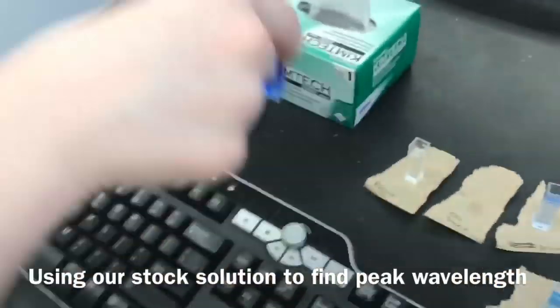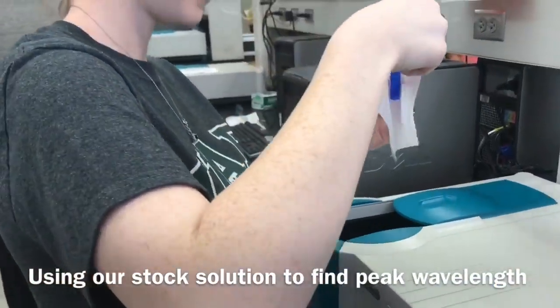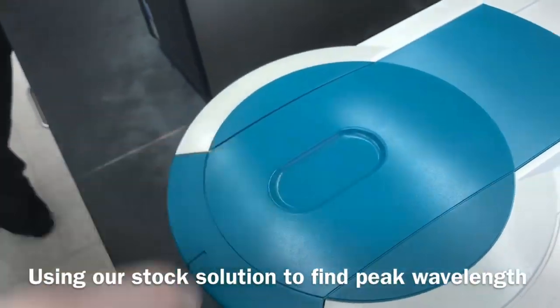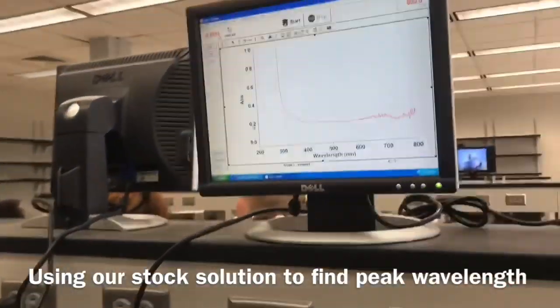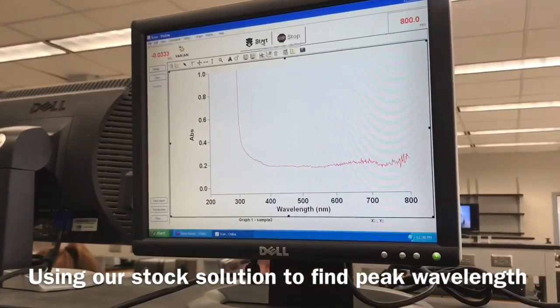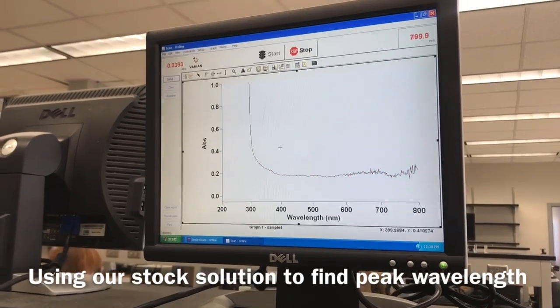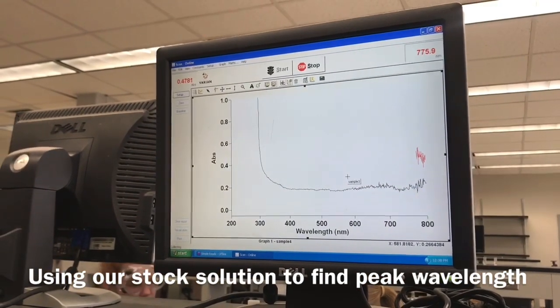Here we are using the scan program on the spectrophotometer in order to find the peak wavelength to scan all of our dilutions at. We do this by using the stock solution. It is important to scan across all wavelengths because every molecule is wavelength specific. The optimal wavelength at which the absorption could be read is called the lambda max.